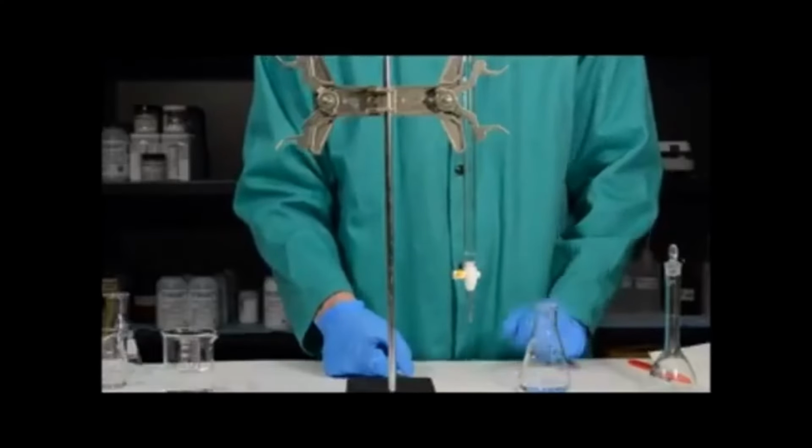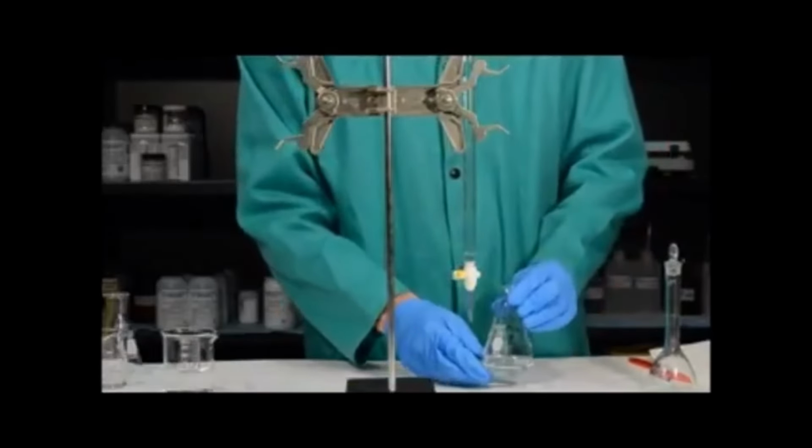You'll also notice that we have tenths graduations on the burette. So, since we have tenths graduations and we need one estimated digit, it means we have to estimate the hundredths place. Said another way, our burette reading should have 2 decimal places, and all burette readings must have 2 decimal places, even if the last decimal place is a 0. In this case, we would read this as 8.72 milliliters.